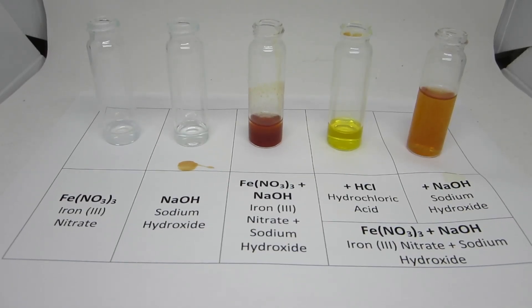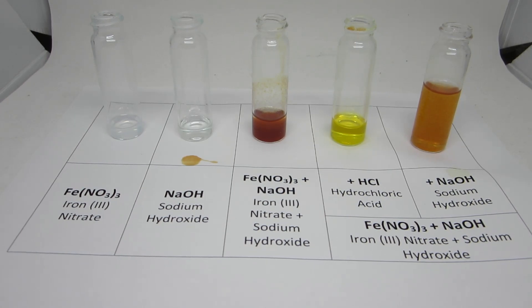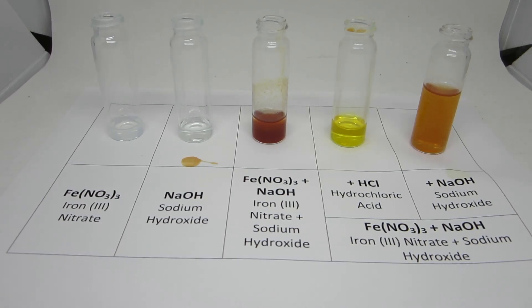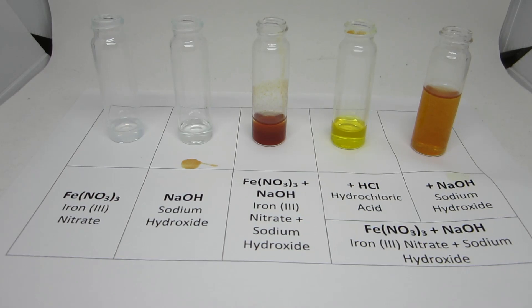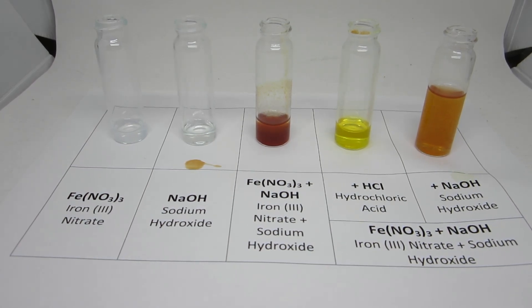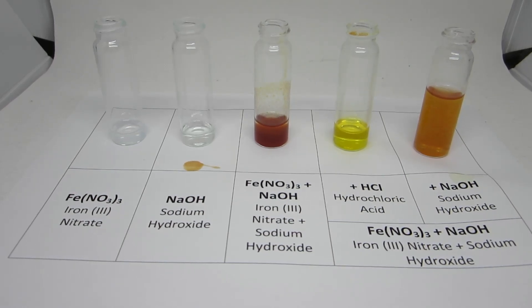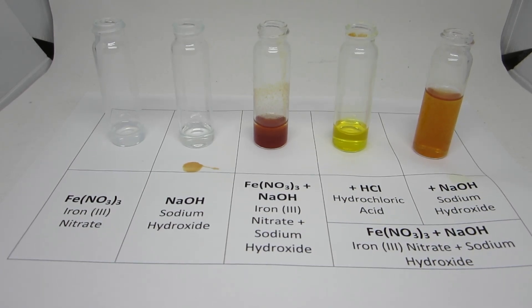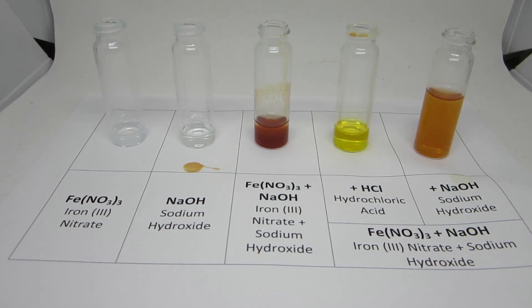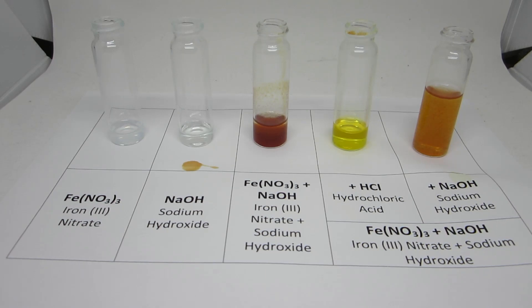Overall, the nearly colorless iron nitrate solution and colorless sodium hydroxide produce the dark brown precipitate of iron(III) hydroxide. With addition of hydrochloric acid, the precipitate dissolves and the iron reacts with chloride ions to form the yellow iron tetrachloride complex. With further addition of sodium hydroxide, the brown precipitate dissolves with the formation of the iron tetrahydroxide complex ion, which is soluble and causes a pale orange solution to appear.